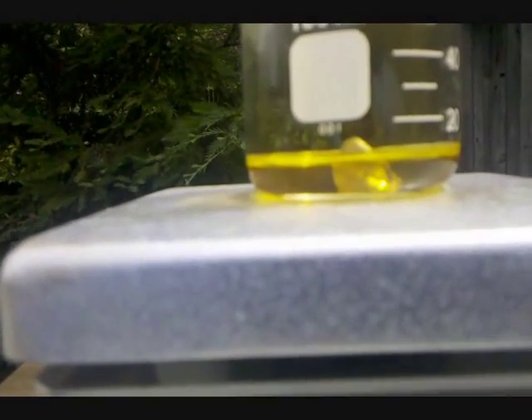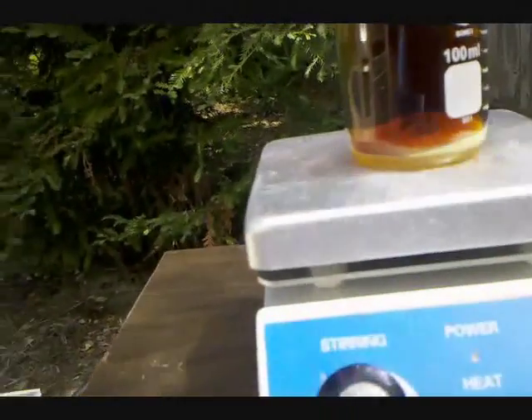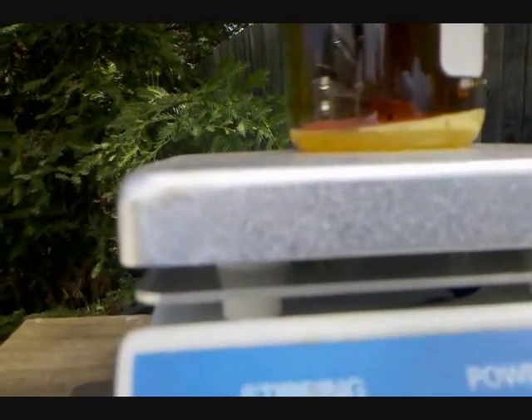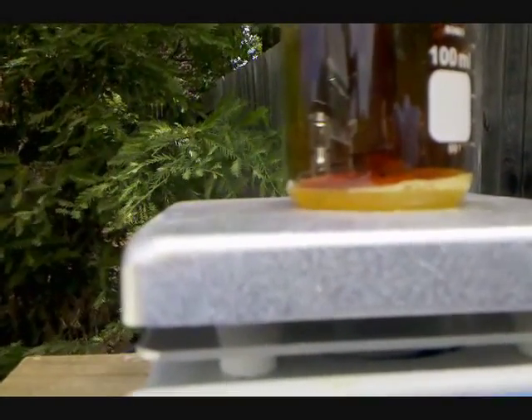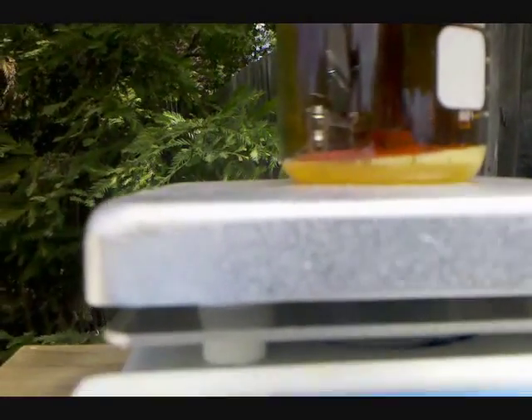It's been about 50 minutes after the Bismuth first started bubbling in the solution, and a second piece of Bismuth has been added since then. The reaction did seem to slow to a stop, with no Nitrogen Oxides being produced but the Nitric Acid bubbling, and I found that this was due to passivation happening, because the Nitric Acid became so concentrated that the Bismuth formed a protective oxide layer. So when I added a small amount of distilled water, after decomposing some of the Nitric Acid, the reaction picked up again, and a small amount of Bismuth Nitrate was precipitated in the solution. It dissolved again, though.